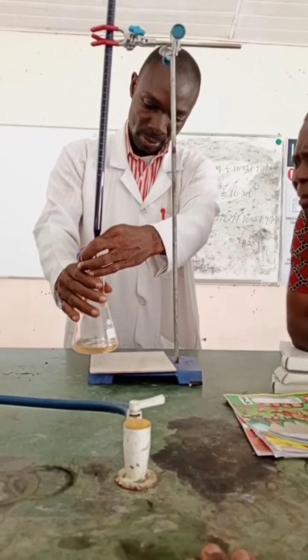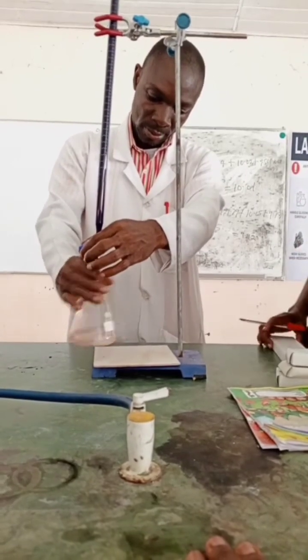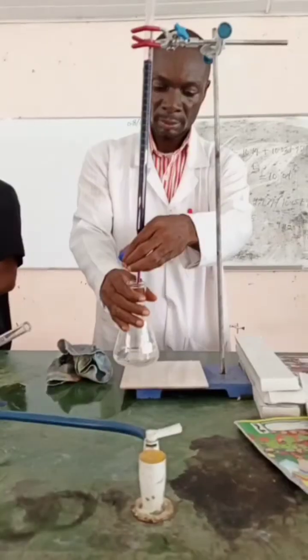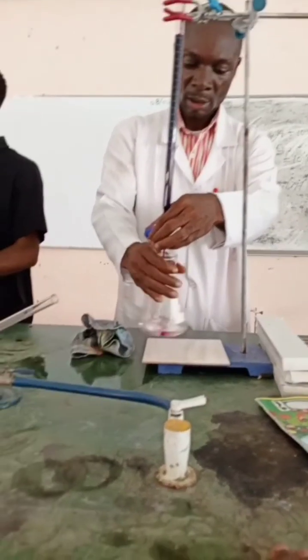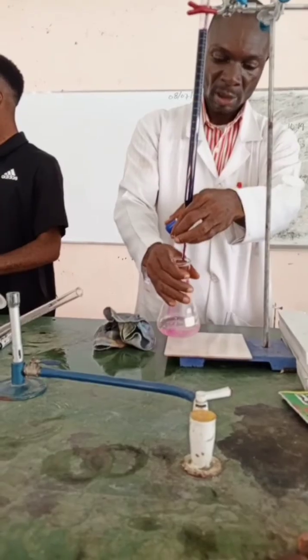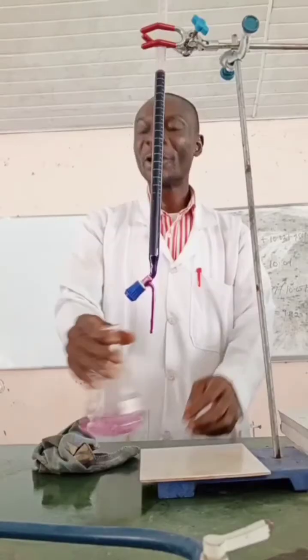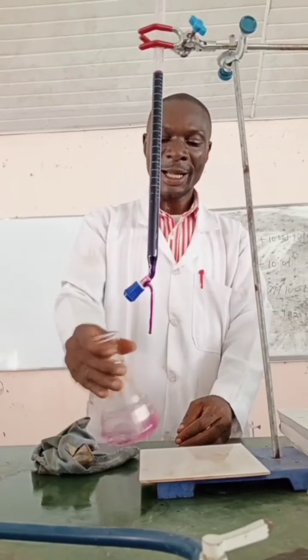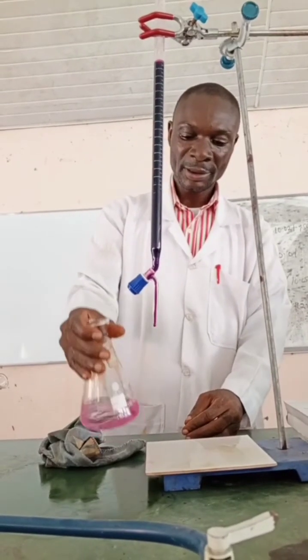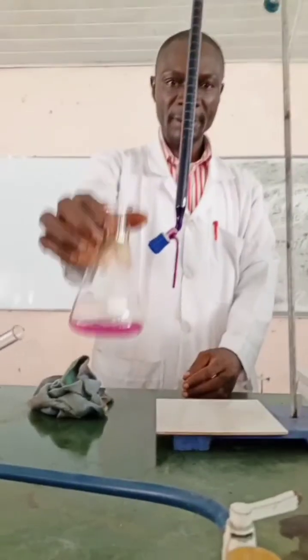We are almost there — you have to be very careful, remember it is dropwise. Just a drop will give you the pink solution. We are almost there — that is it.